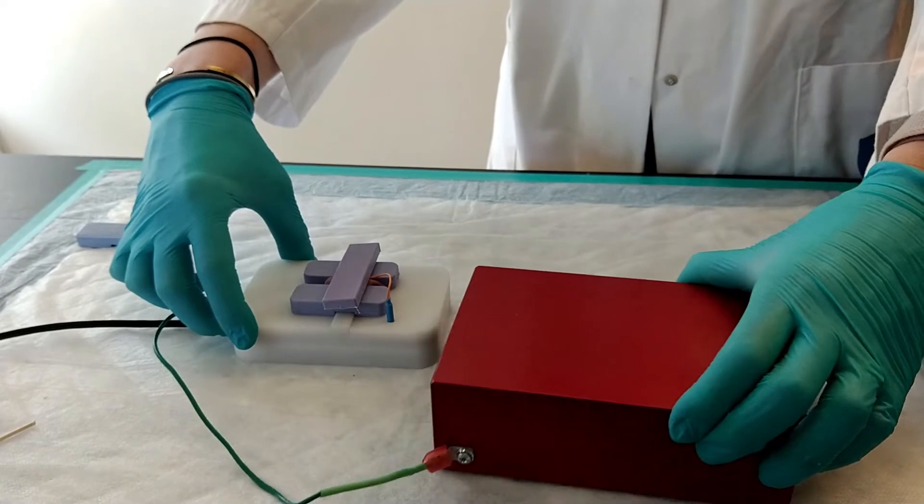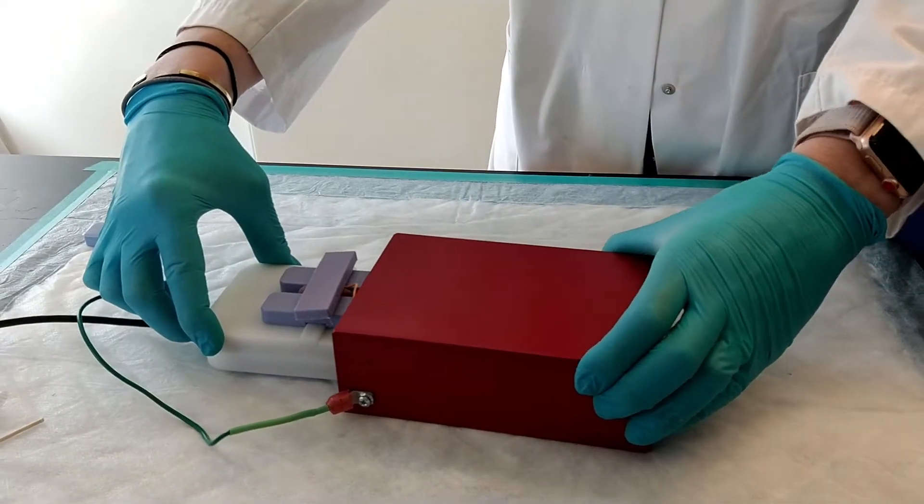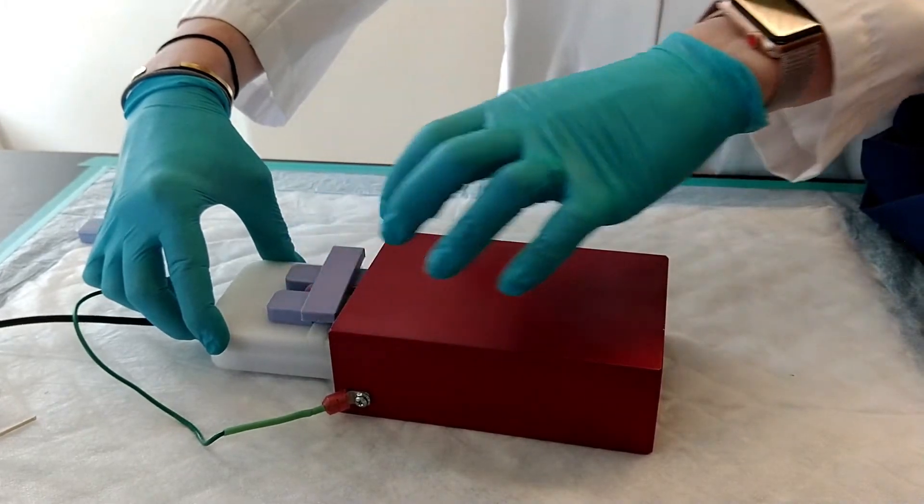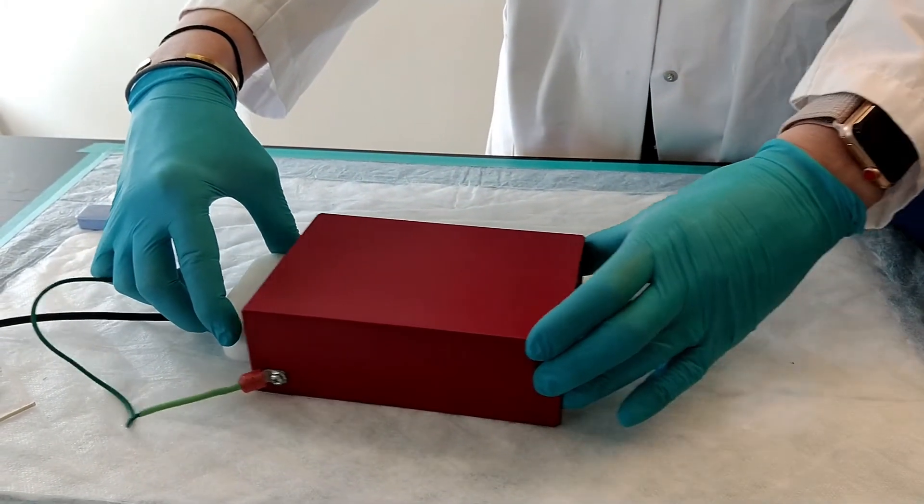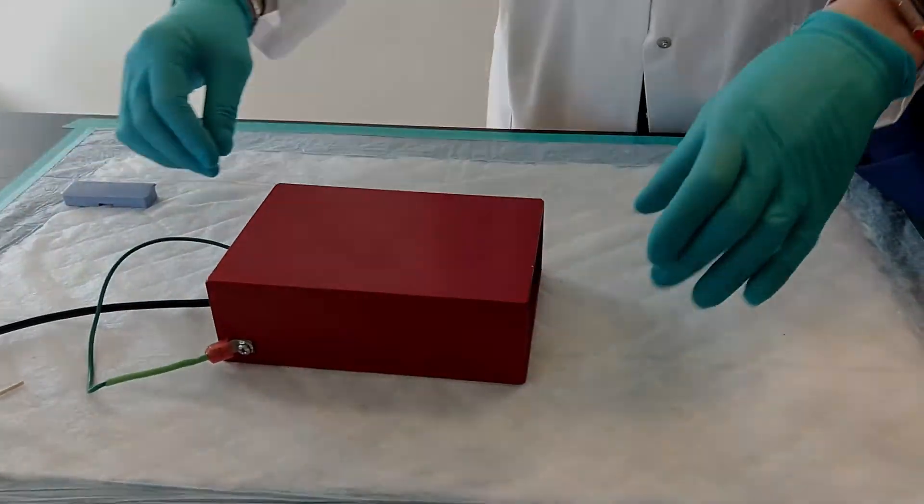Finally, put the entire platform into the Faraday cage, and now you're ready to record.